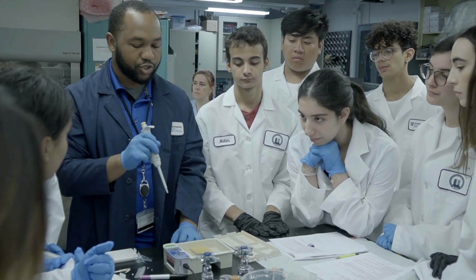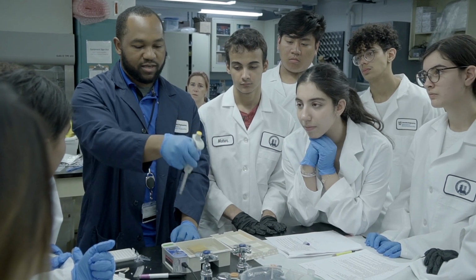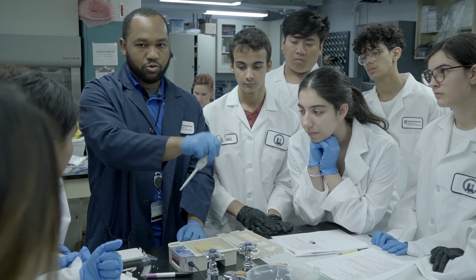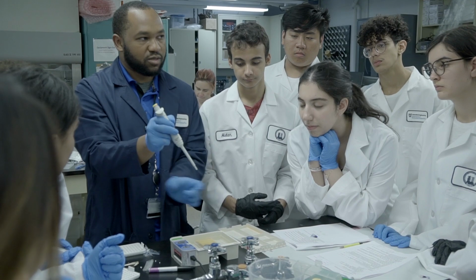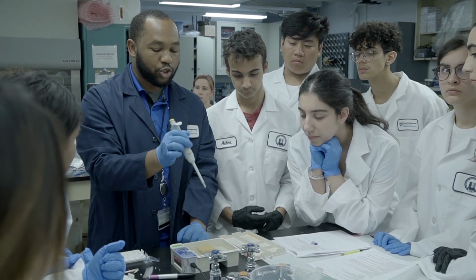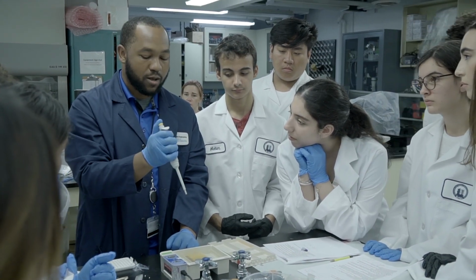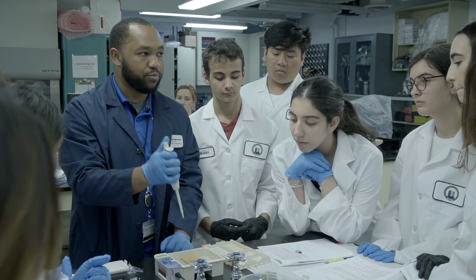The important things are make sure you're straight in either this way, anywhere here is fine. Do not do this, right? Because you're gonna puncture the gel this way. All right. So either way here is fine. Please make sure you are all the way inside the well when you eject. Okay. And once you've ejected all the way, please pull out.